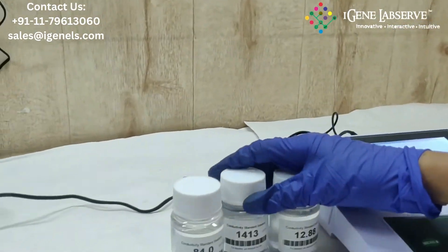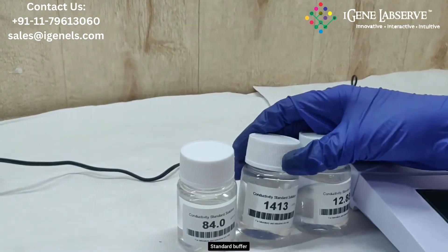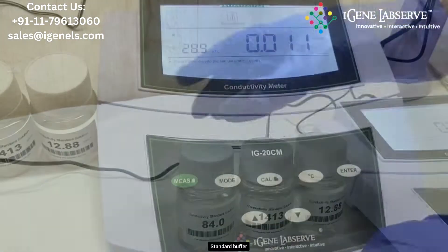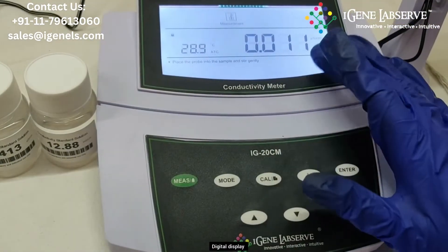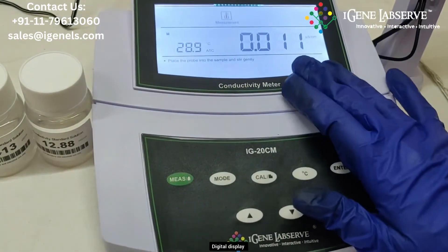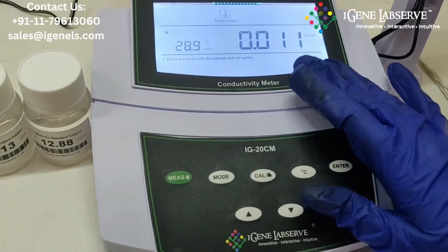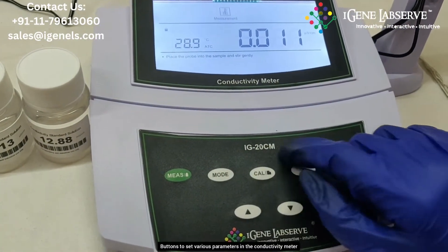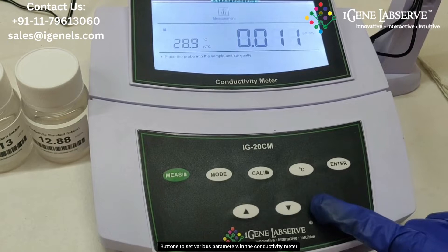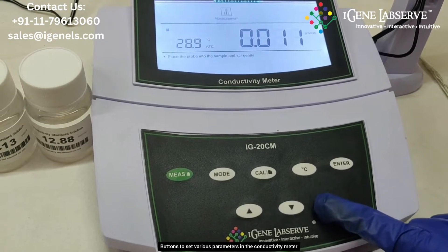It also comes with three different conductivity standard solutions. This is the digital display of the conductivity meter, and these are various buttons for controlling the various parameters.